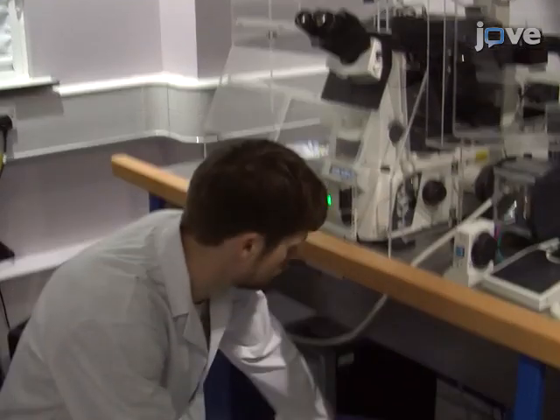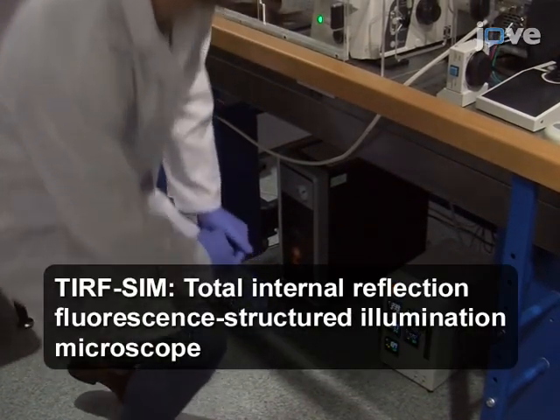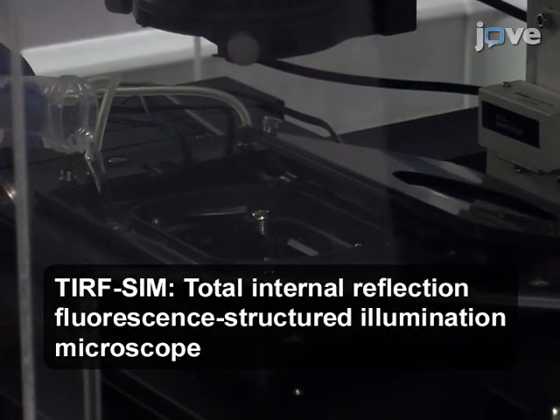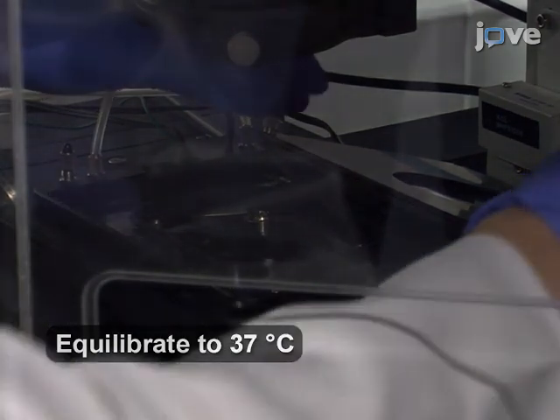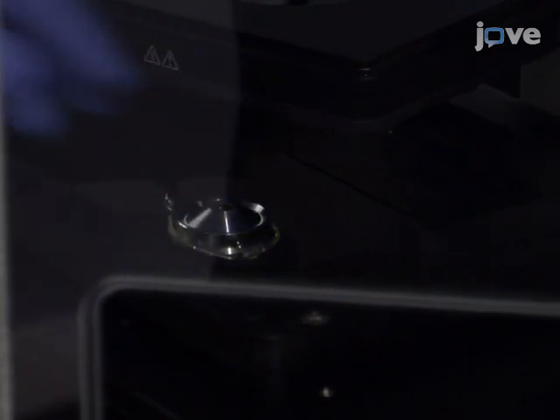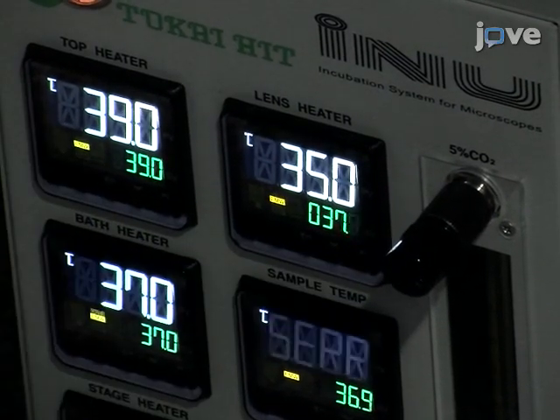To begin, turn on the incubator for the stage heater of the TIRF-SIM system and fill the reservoir with distilled water to fully cover the base of the heating element. Let the water equilibrate to 37 degrees Celsius. Connect the heating collar to the objective lens and set it to 37 degrees Celsius.